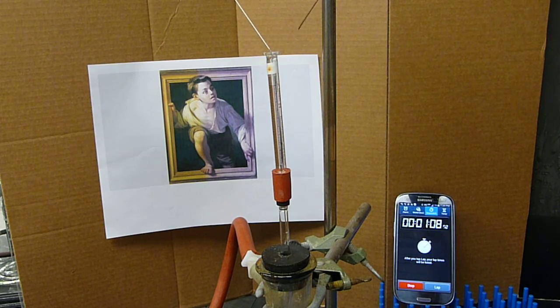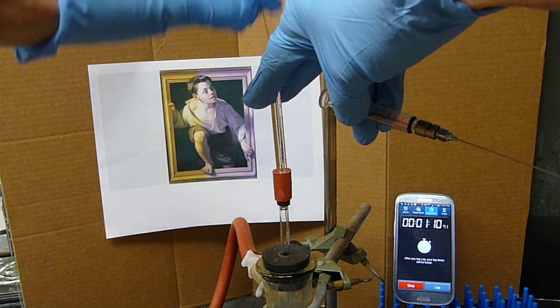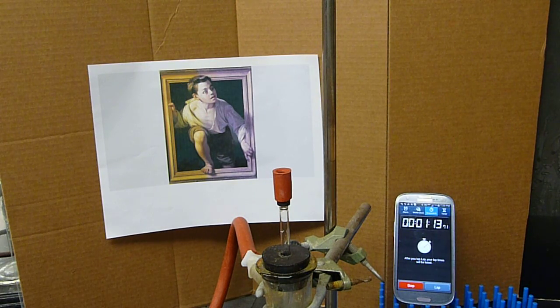All right. Ta-da. Another one and a half ml through a 25 microliter syringe. Ta-da.